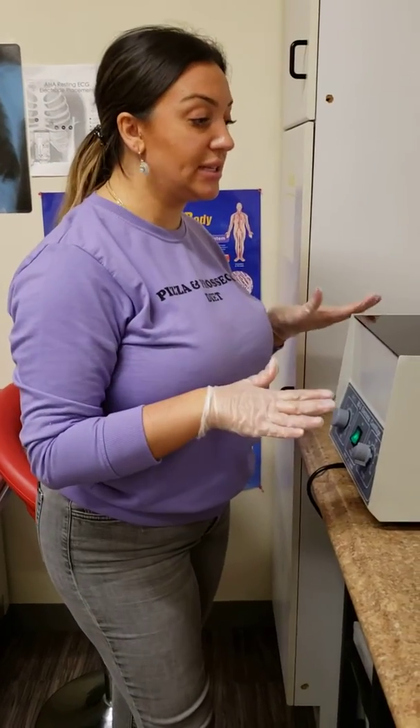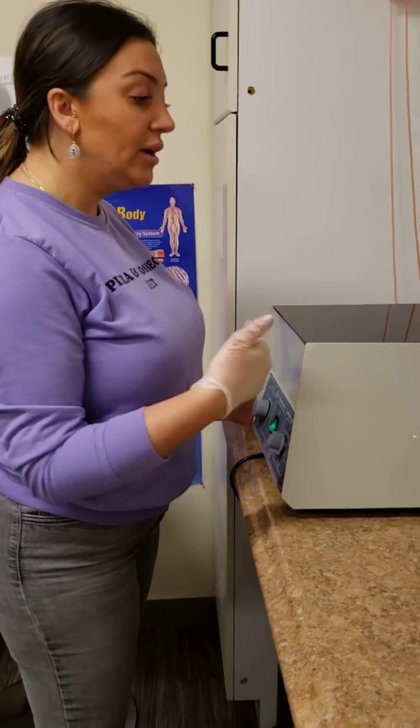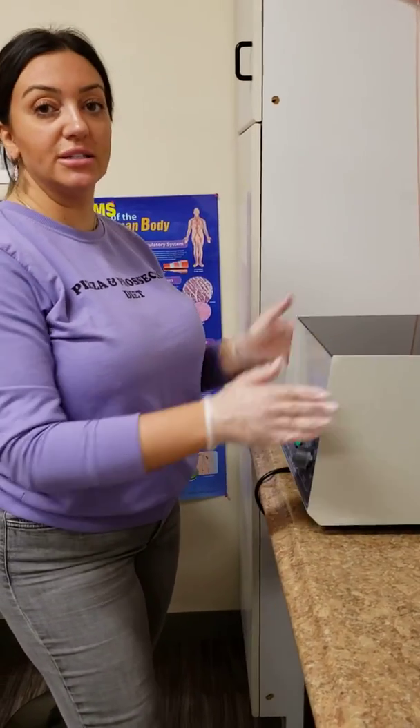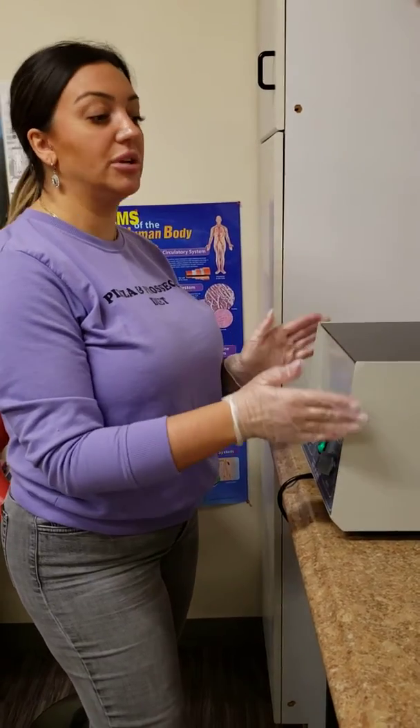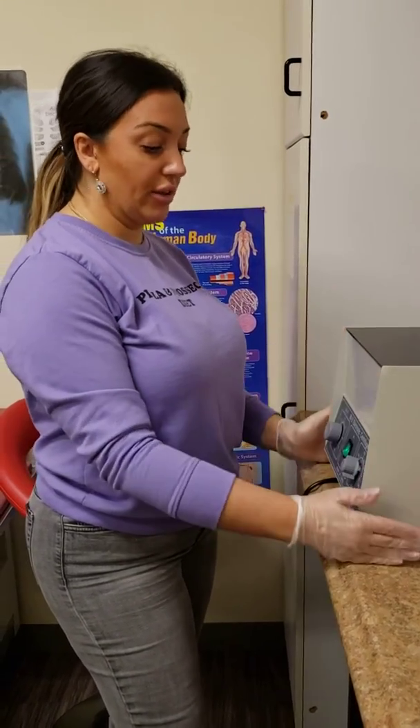As you can see, the machine is stationary. You can hear that it's running, but it's not vibrating and it's not jumping around. It's showing me that it was loaded balanced because it's running nice and calm. There's nothing wrong here.